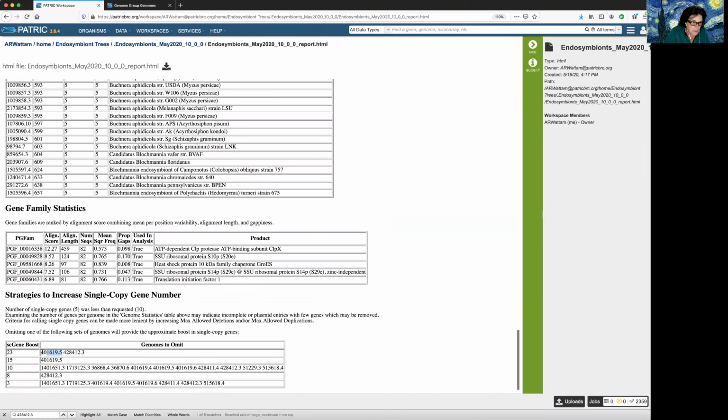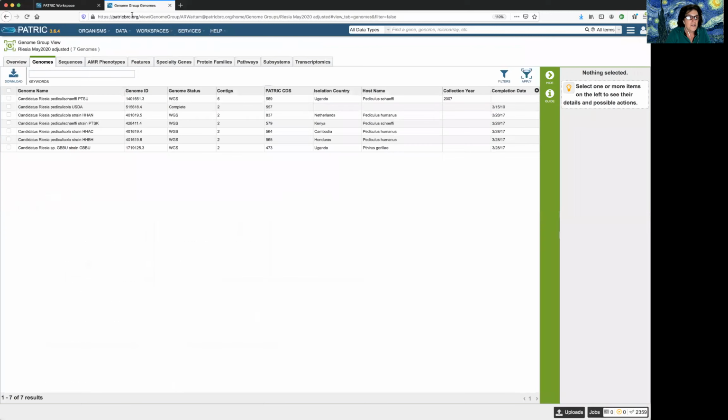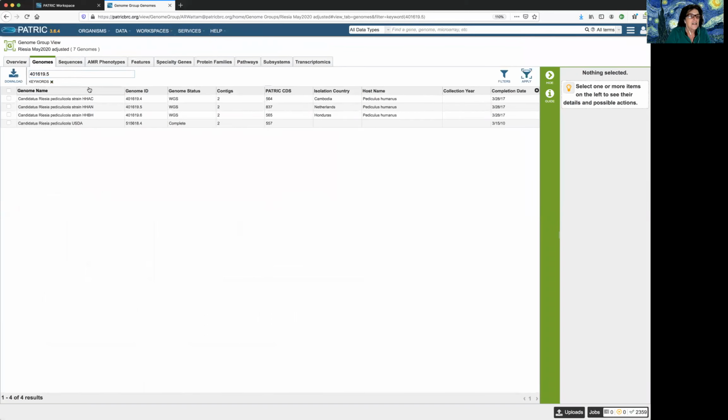Another one that was a problem was this guy. So I copy that. I go into my second tab and I paste that and hit return. Oh, now look at this. How annoying this is. I've given it an exact term and it's returned basically pretty much everything, which is annoying to me. One way you can thwart your computer is to put quotation marks around that and then hit return, and there's the one, the HHAN genome.